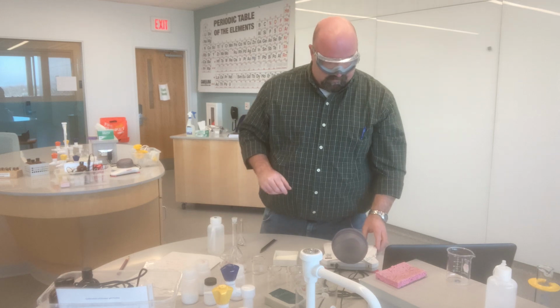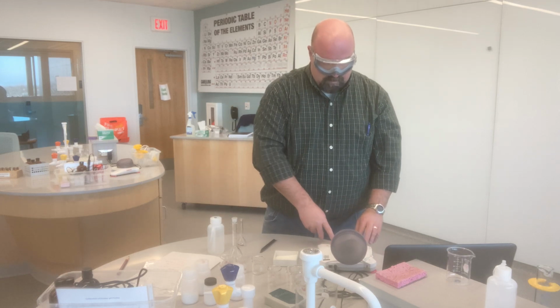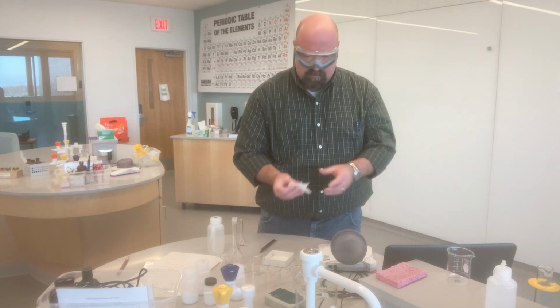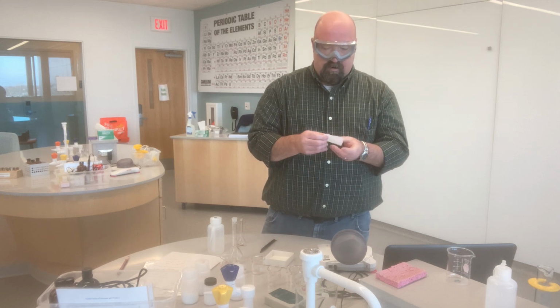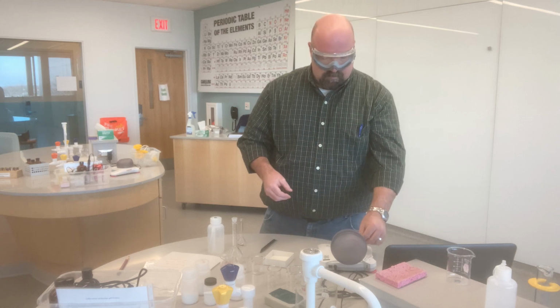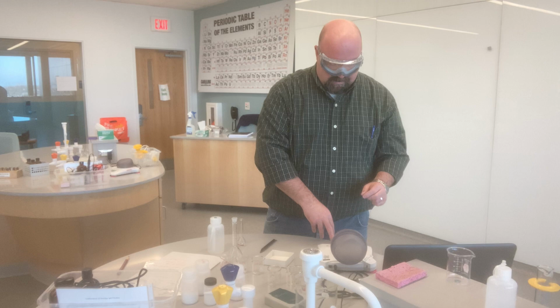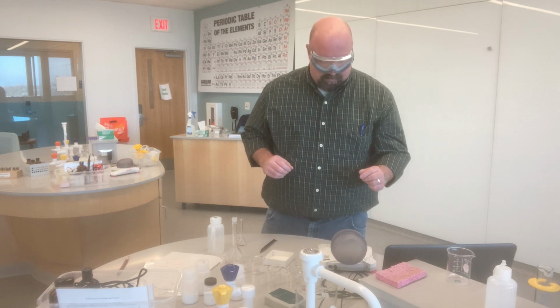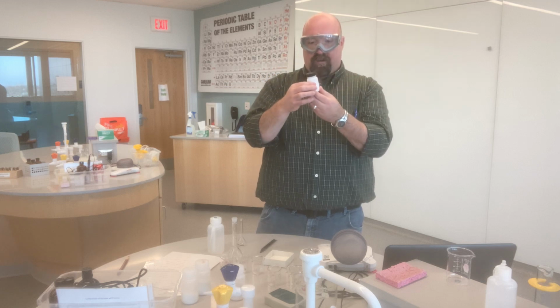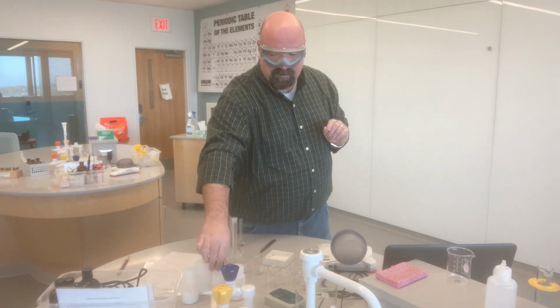So my balance here is started and ready to go. I'm going to go ahead and zero it, tare it out, get my weigh paper, get that ready. Put my weigh paper on the balance. Tare the balance again so it's ready to go. Here I've got my ammonium nitrate solid. Hopefully some of you caught me.